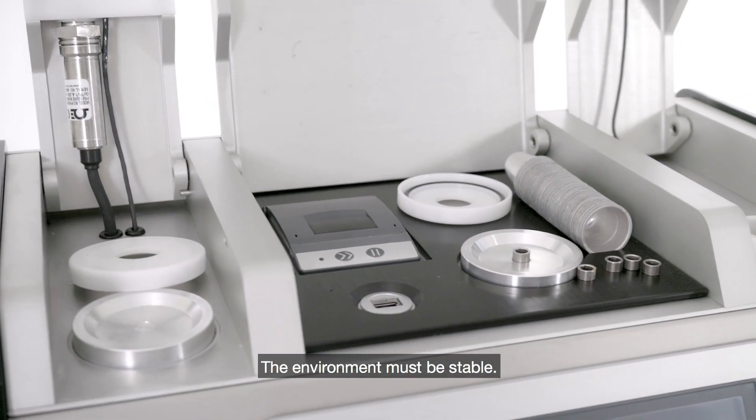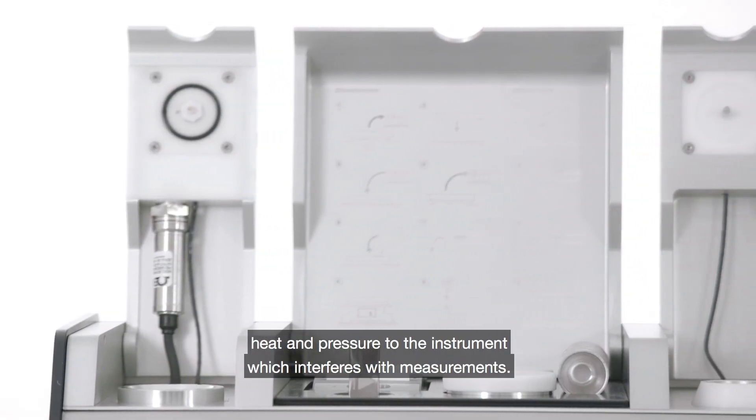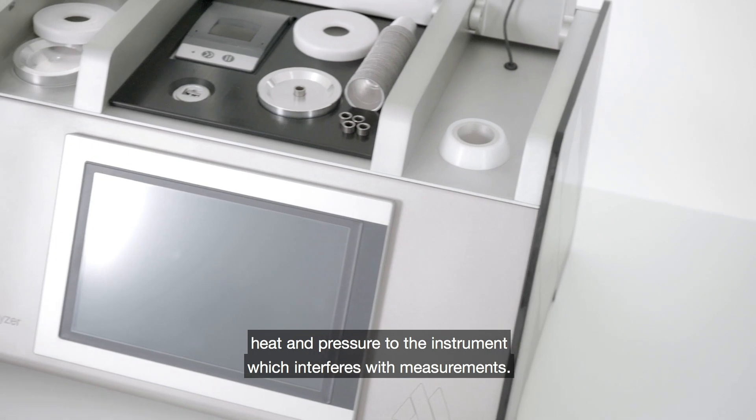The environment must be stable. Be careful not to touch the instrument during test as this provides both heat and pressure to the instrument which interferes with measurements.